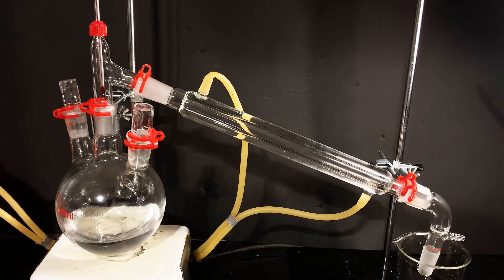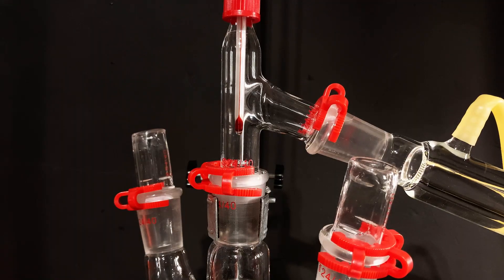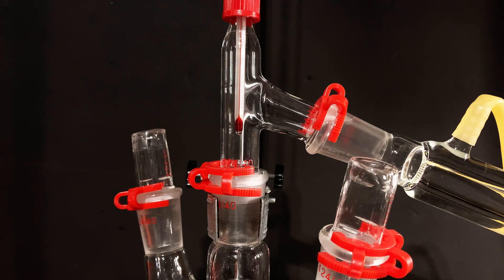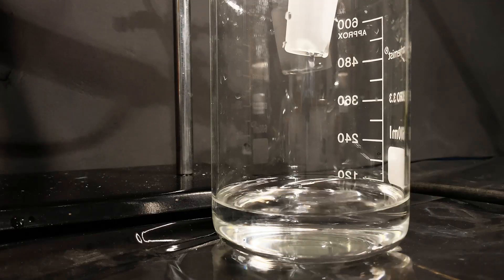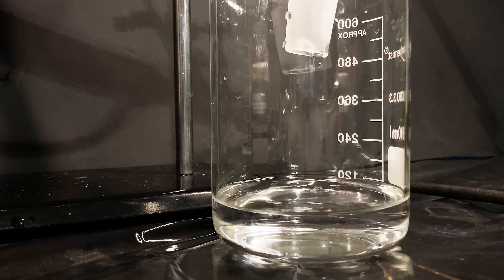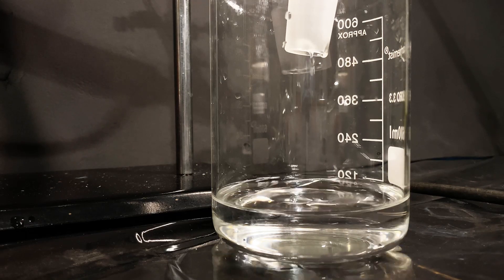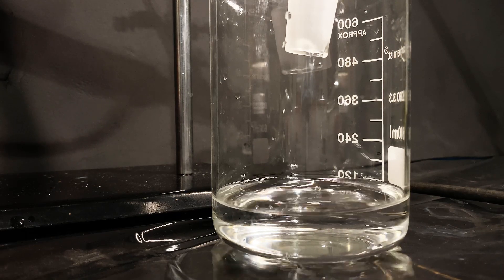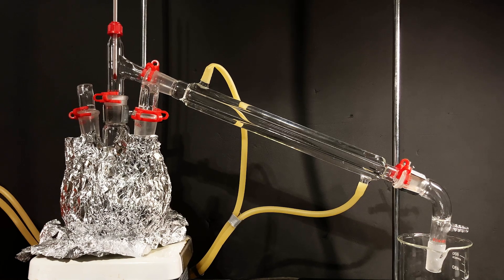So today, I'll be showing you guys how I was able to obtain pure isopropyl alcohol from hand sanitizer. You can do this with an ethanol based sanitizer as well, and a channel called Labcoats which I've been watching for a while now made a video on that too. Now this one's going to be a quick one, so let's hop right in.